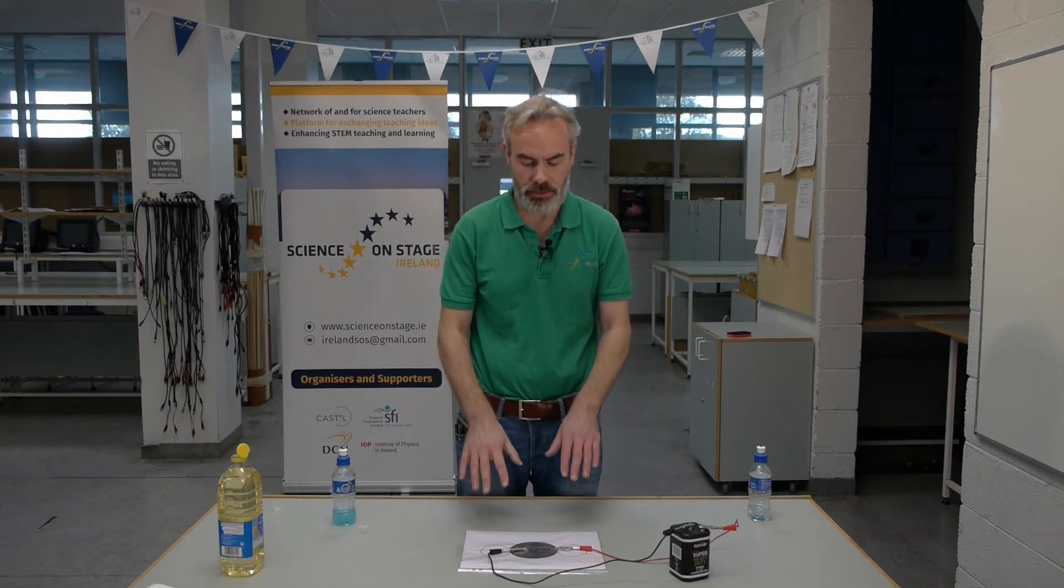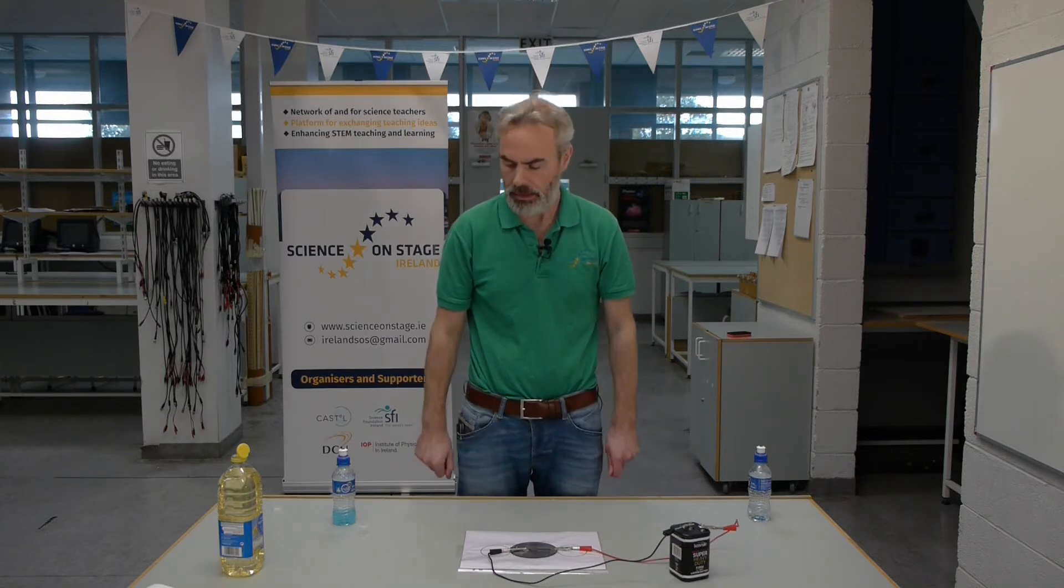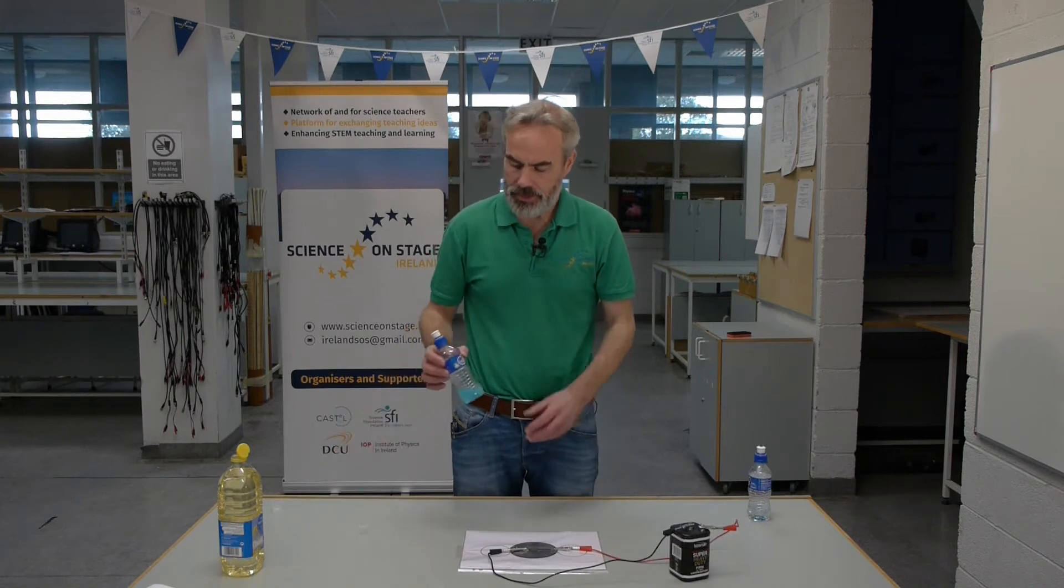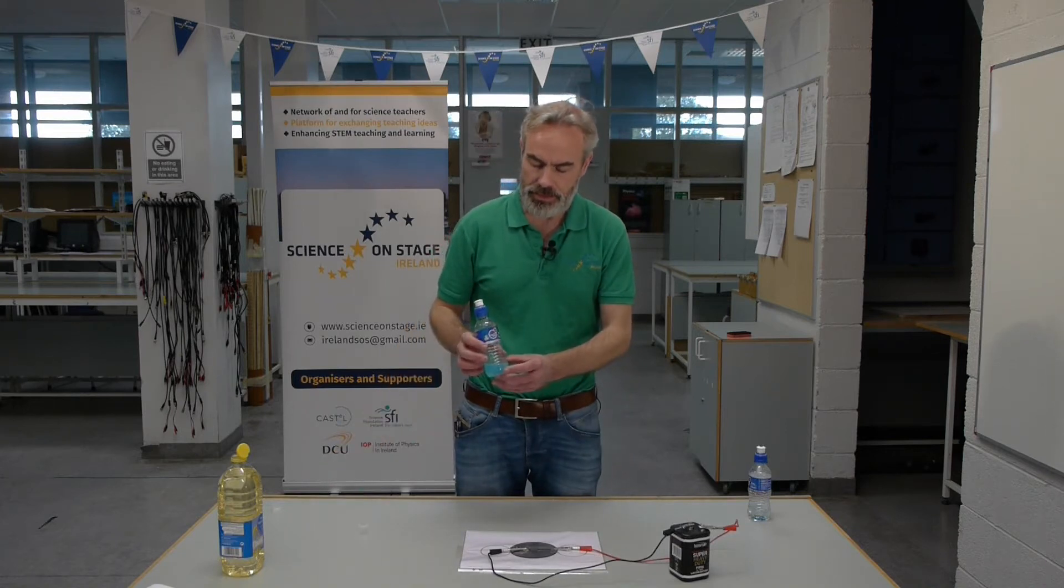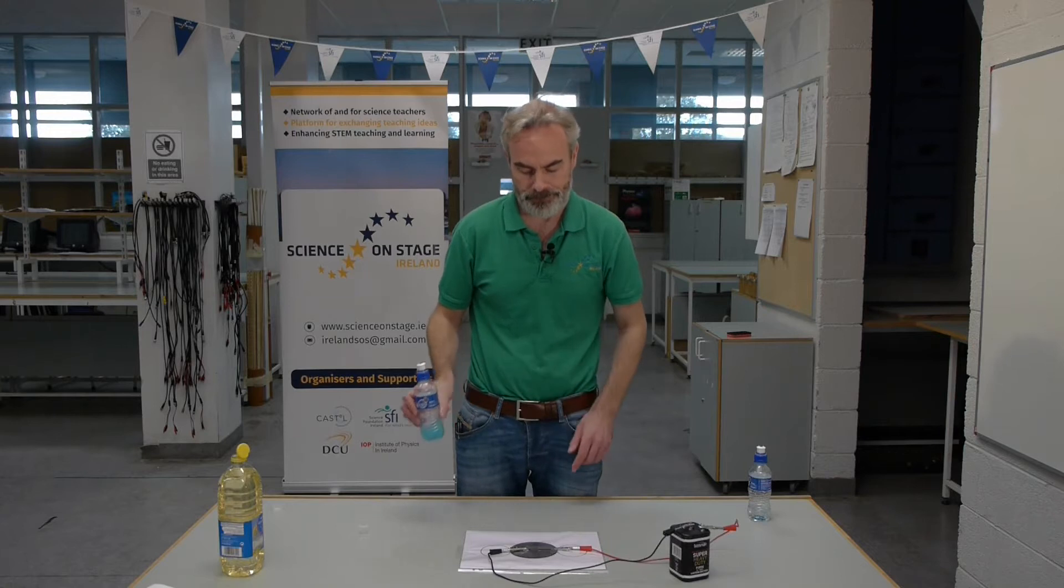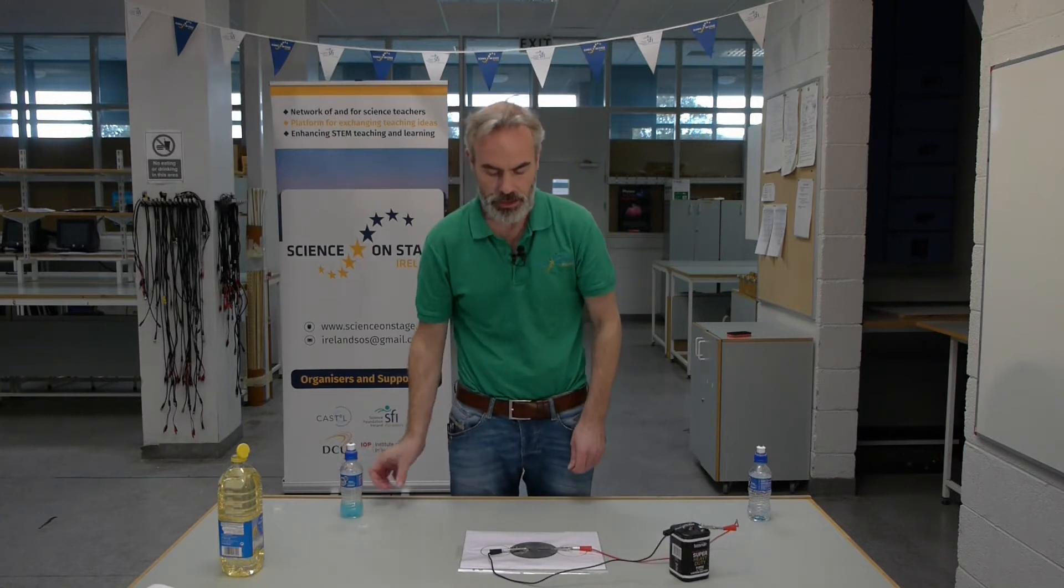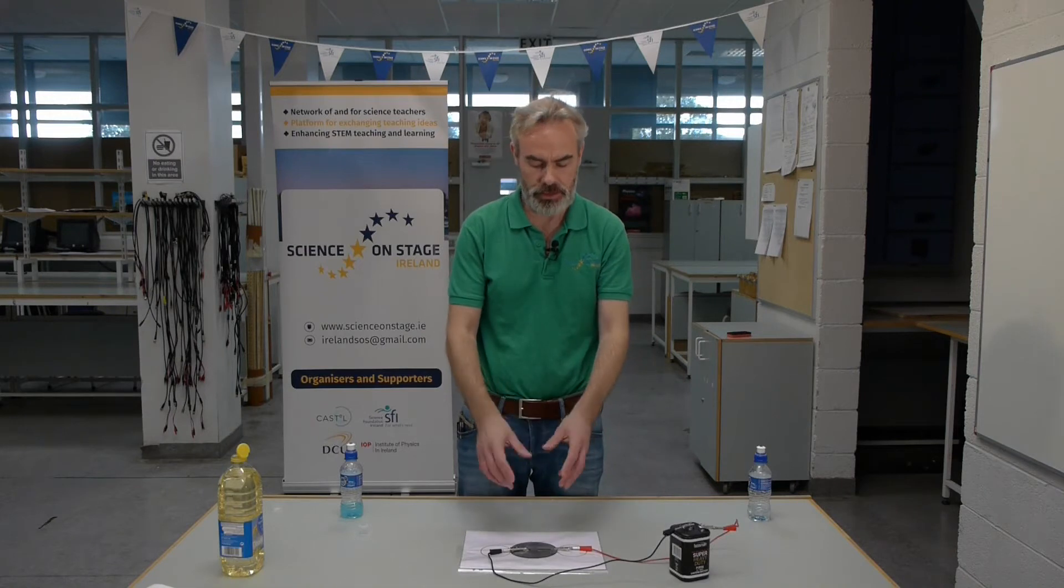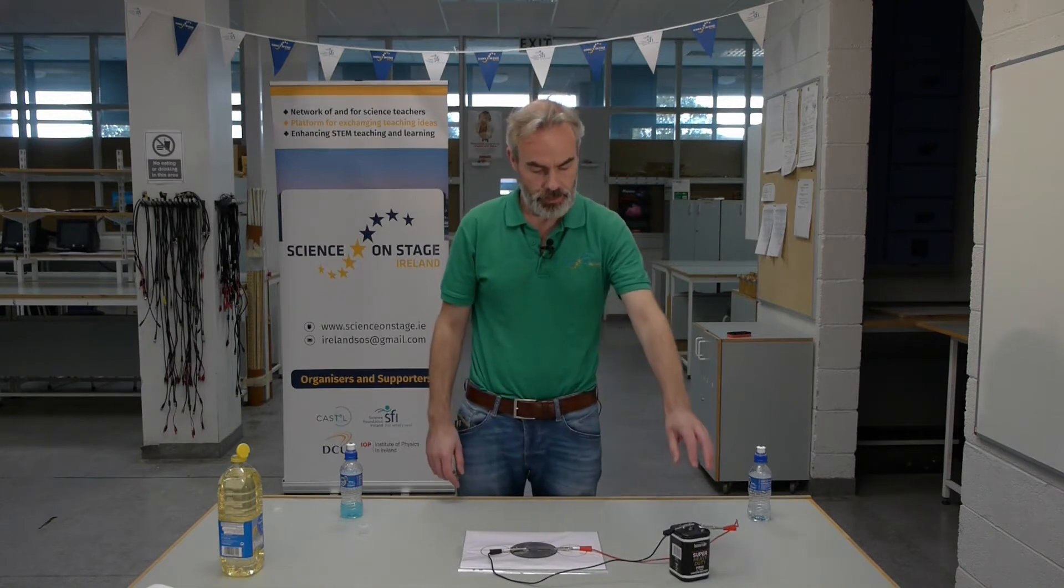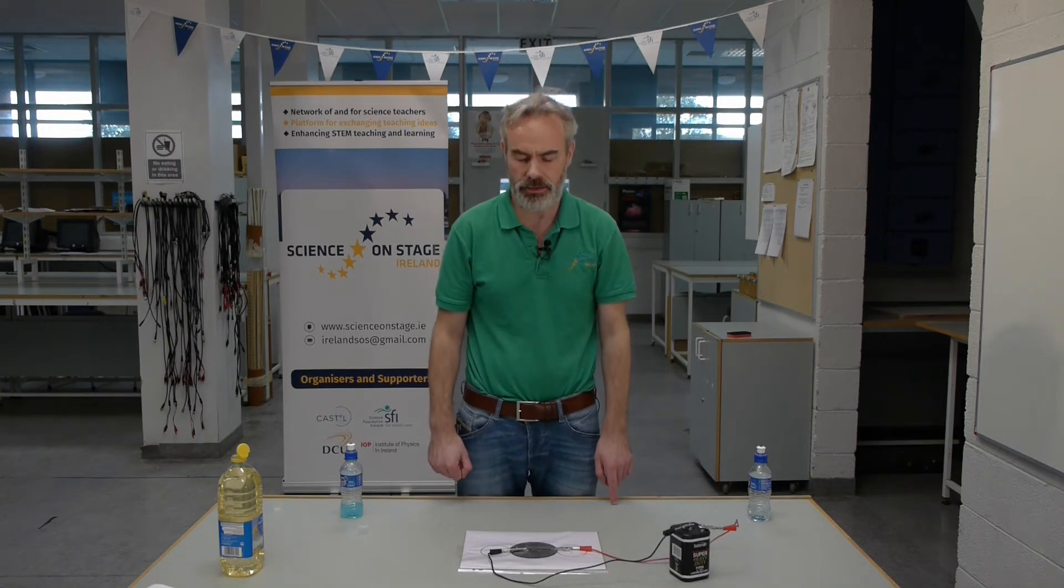This experiment involves electrolysis using polypockets. I am first going to electrolyze copper chloride in a large circle where there are graphite electrodes from a pencil. I have a six volt battery connected to those electrodes.